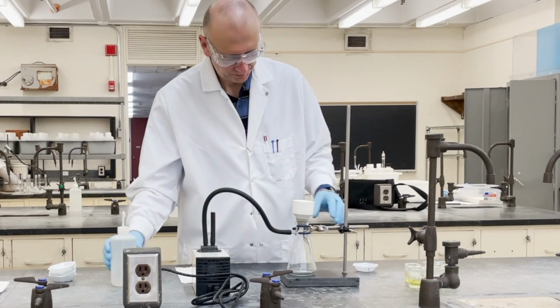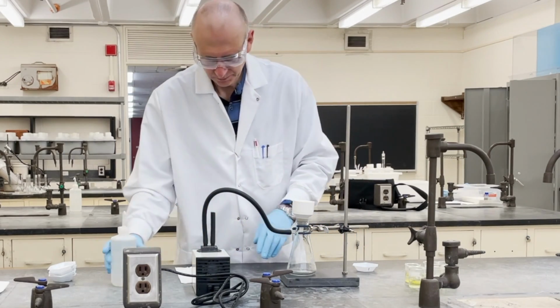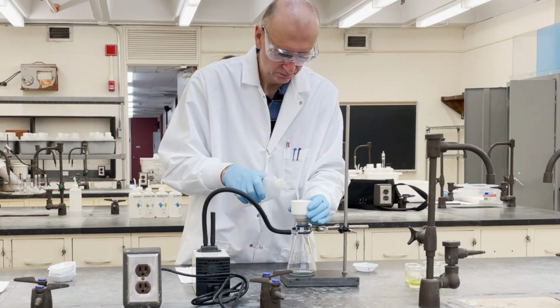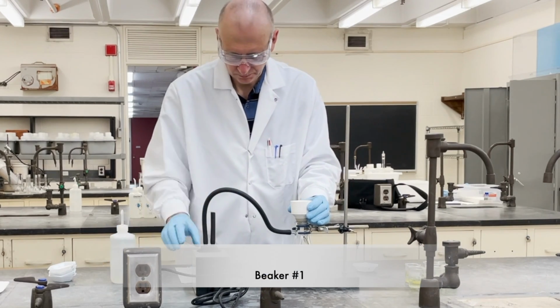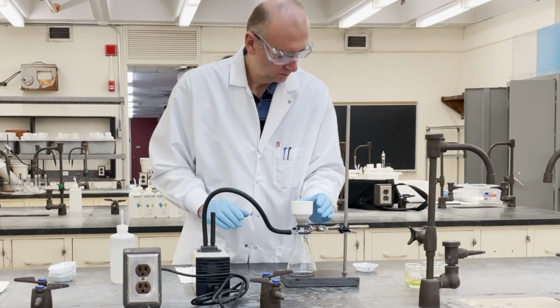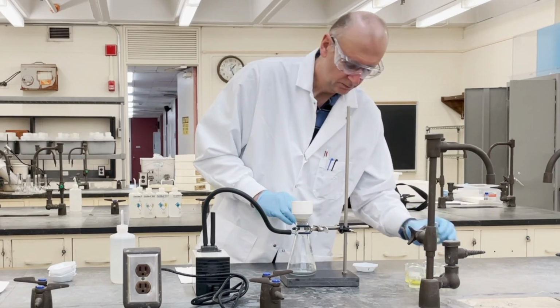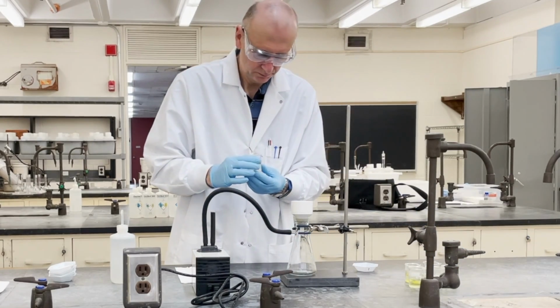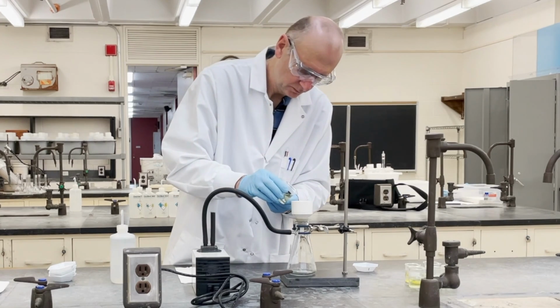When you're ready to filtrate, take the filter paper from weighing dish number 1 and place it onto the suction filtration funnel. Apply a little water onto the paper, then turn on the aspirator. A suction will be generated, pulling air into the flask. Carefully filtrate the solution from beaker number 1 onto the filter paper.